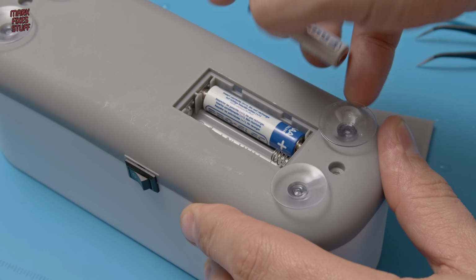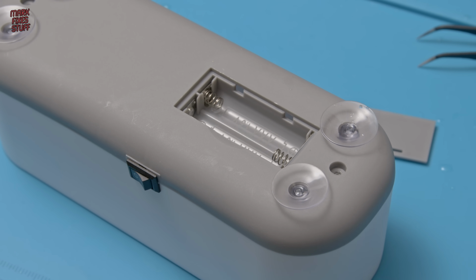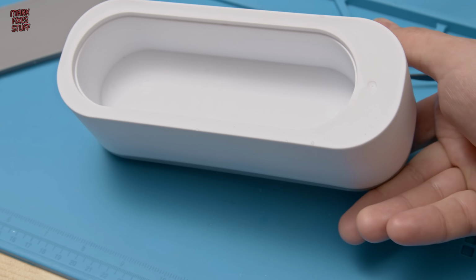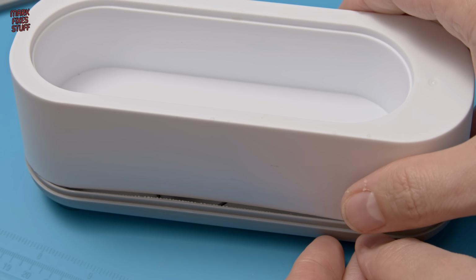I'm not sure how much juice is left in these batteries, but they'll probably be alright for a remote control or something. With one screw removed and the other one died of shame, let's open this up and see what makes it, well, suck.